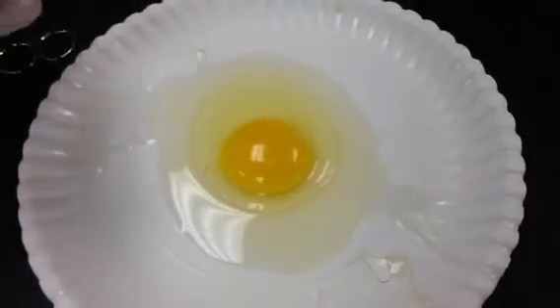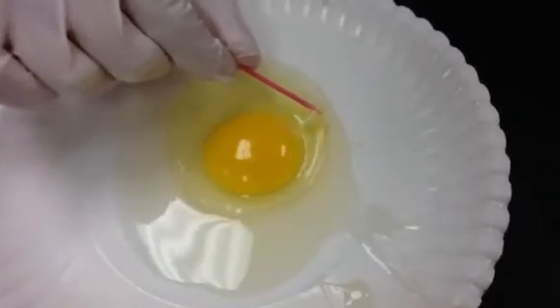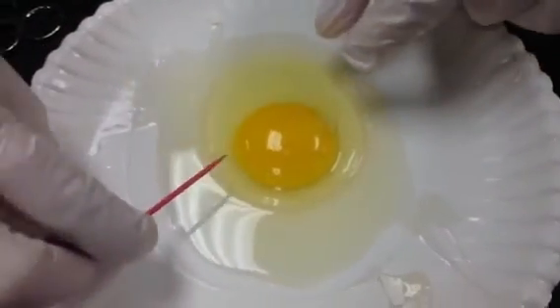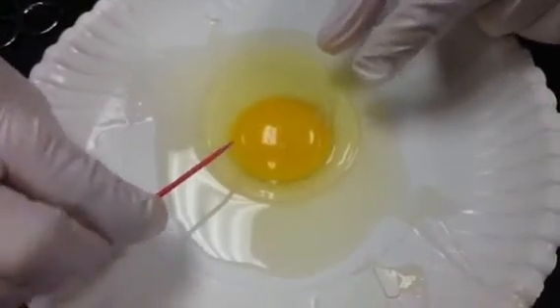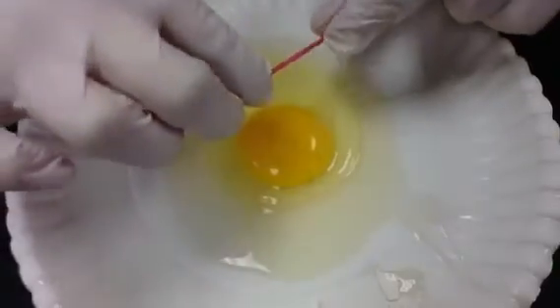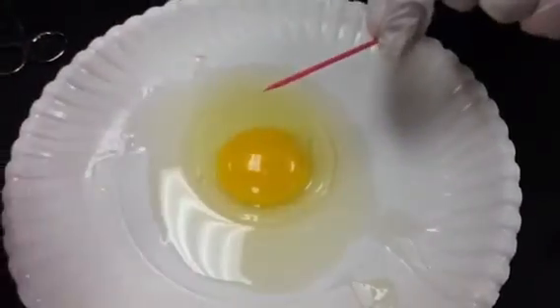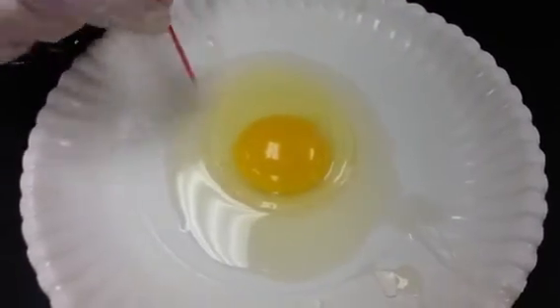So now that's basically the parts of the egg. This part here, we haven't talked about it, but it's the chalaza, and basically it's the piece that comes off of both ends of the yolk, and it keeps the yolk in the center of the egg. It's kind of like a support system, like two beams. So you think about it like this: it's a beam going from the two sides that keeps the yolk in the middle so that it's not breaking.